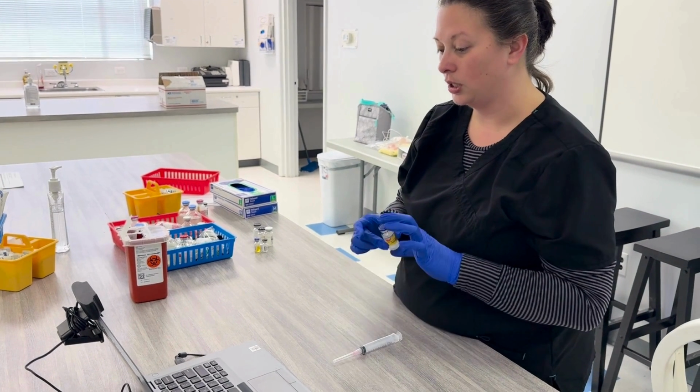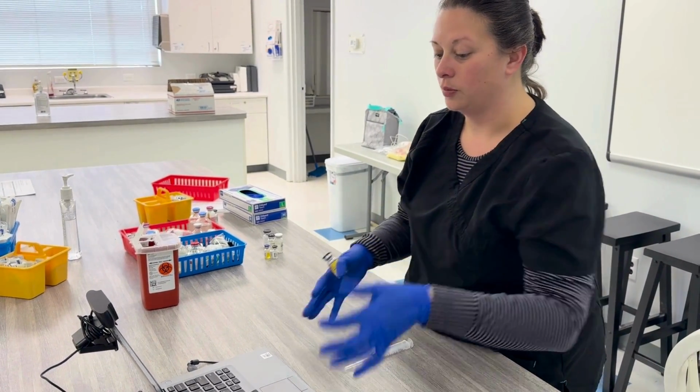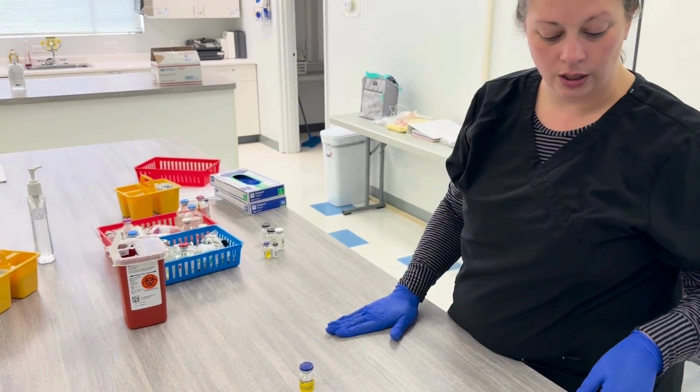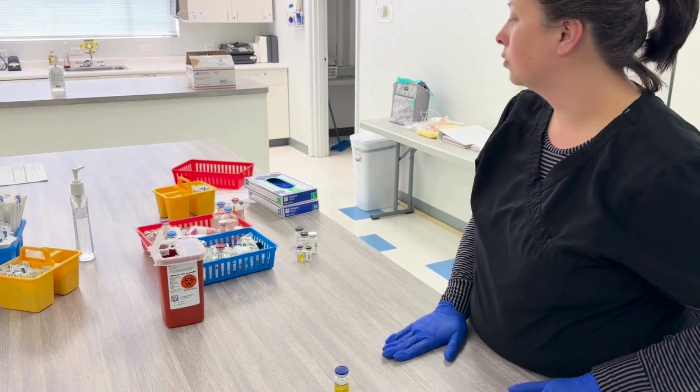Next manipulation, and that's drawing up. So before we draw up, this is where we're going to go.